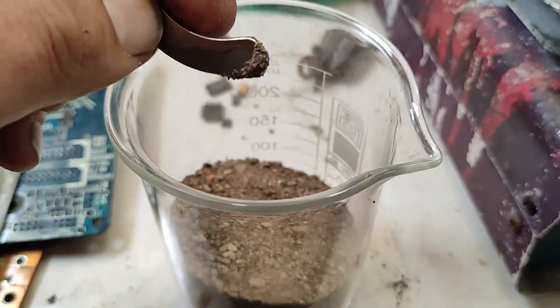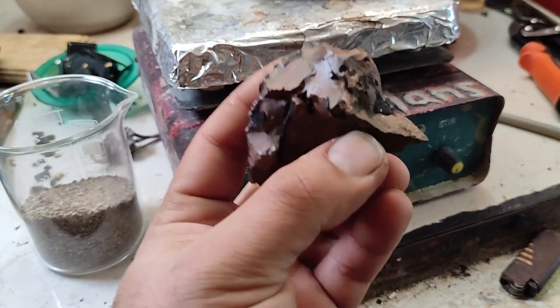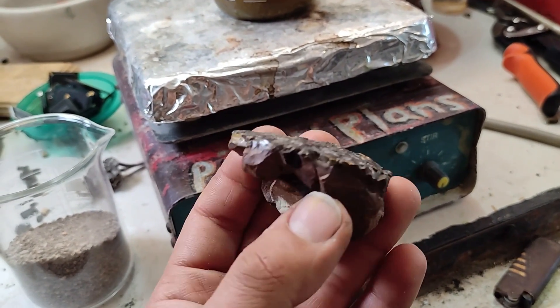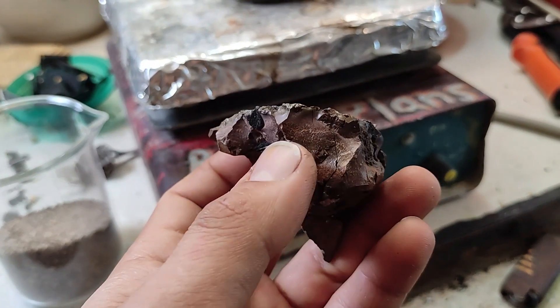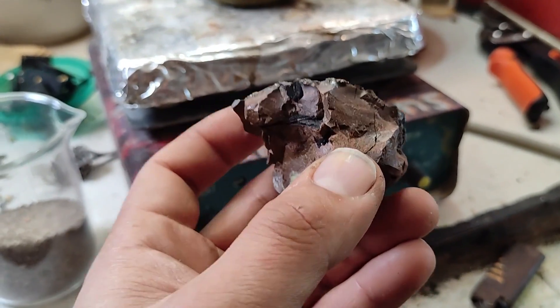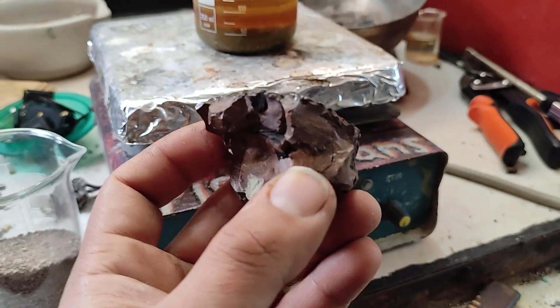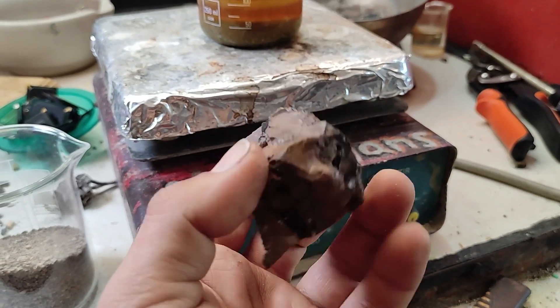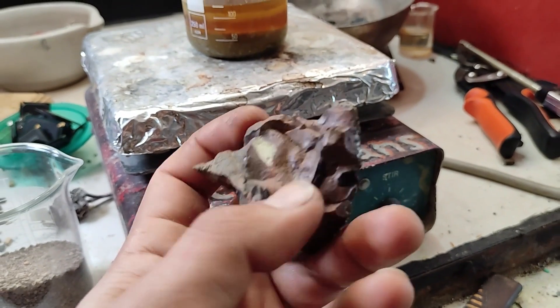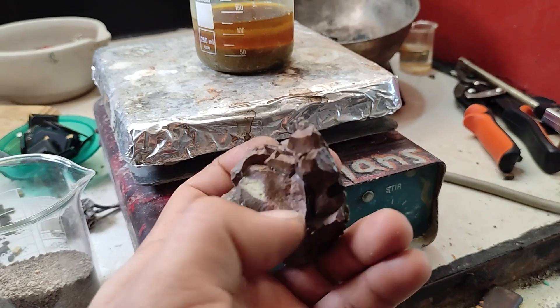I have another sample that may look like a rock, but it's actually slag from high-temperature processing of that gold sample. My friend managed to get only 5 grams of gold per ton, which is very low because he didn't do the desulfurization process. This rocky material is called matte — it's melted base metal sulfide such as iron sulfide, which is porous and holds gold inside, preventing it from transferring to the metal bead.